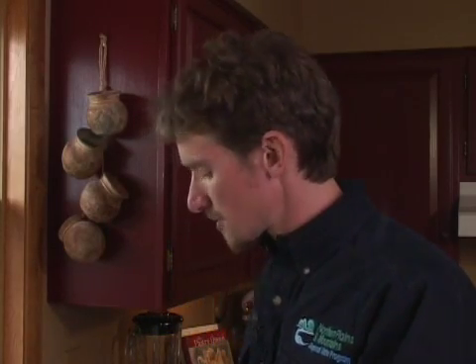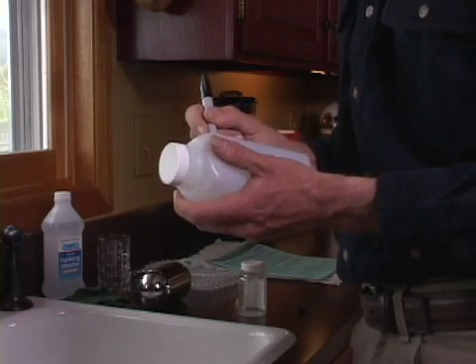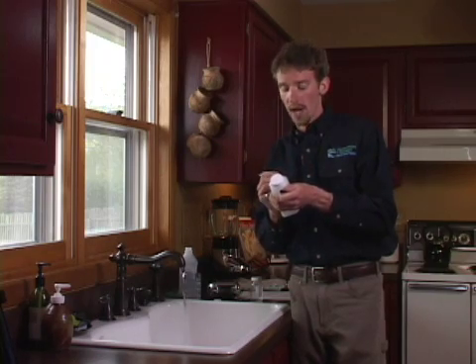I'm going to let the faucet flush for a few minutes. While the lines are flushing, I'll go ahead and label my sample bottles. I want to include my name, address, date and time of sampling, and any comments, using a permanent marker or a pen that will not wash off when the bottle gets wet.